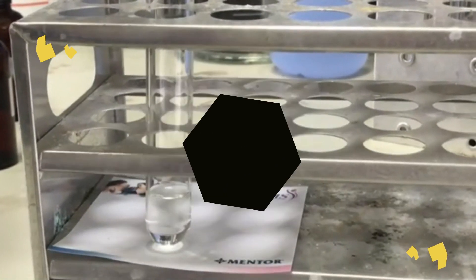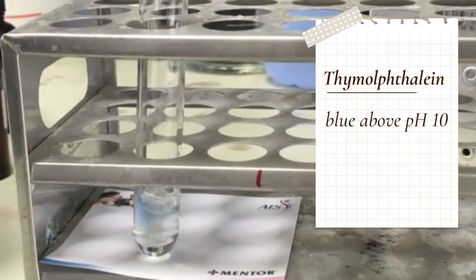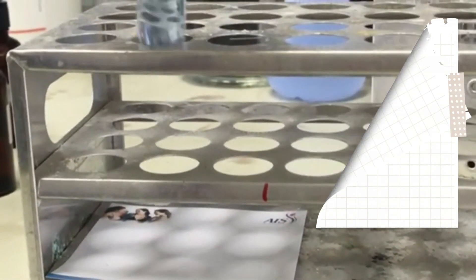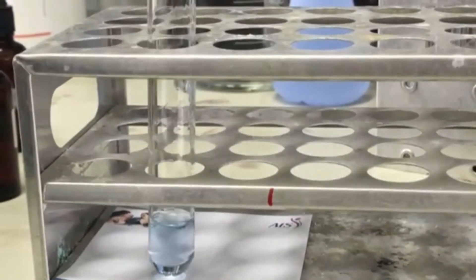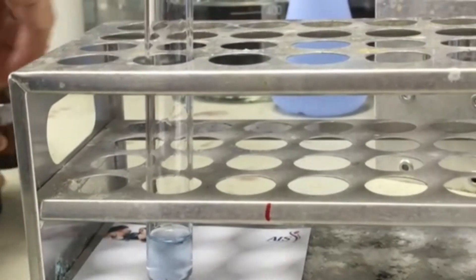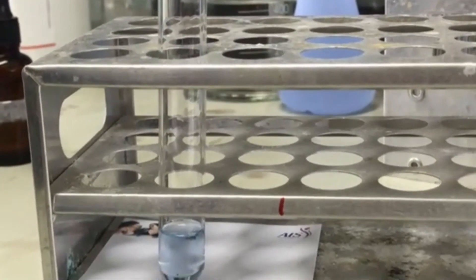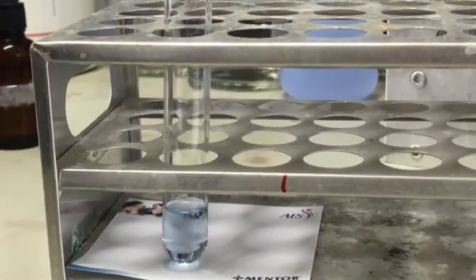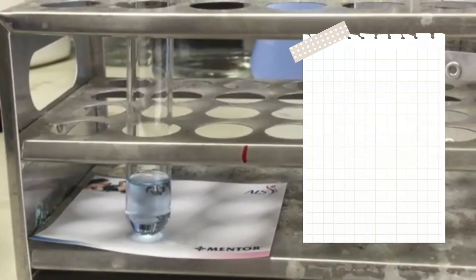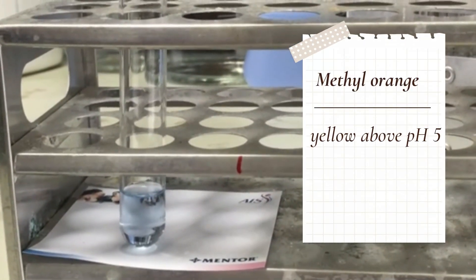This is a solution of ammonia, and I will add thymolphthalein indicator, which is blue in alkaline condition. Now we want to see what happens if methyl orange is also added. Methyl orange is yellow in alkaline condition.